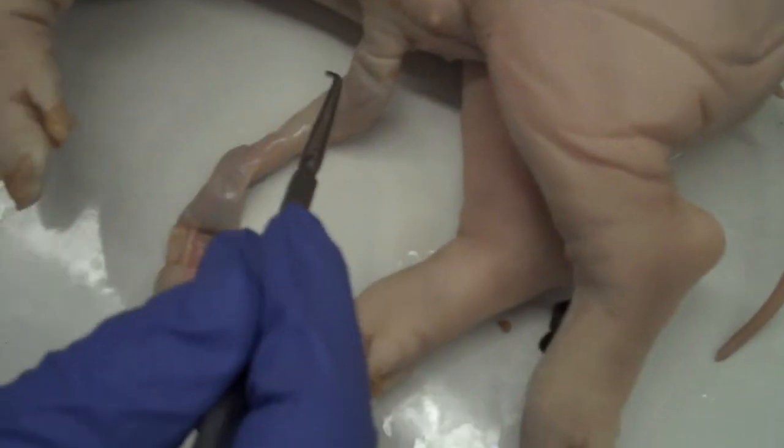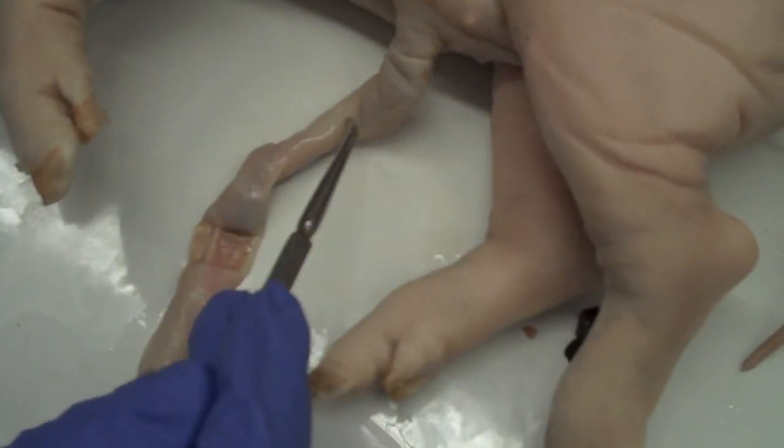The remaining external features are the umbilical cord. In the umbilical cord, you can see the umbilical arteries, the umbilical vein, and then really small is the allantoic stalk.